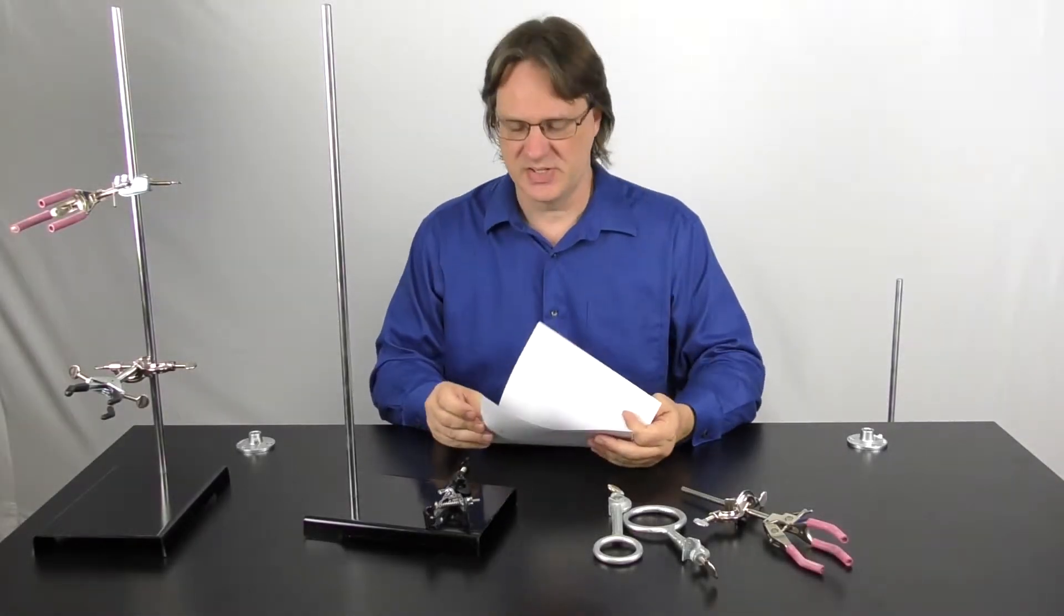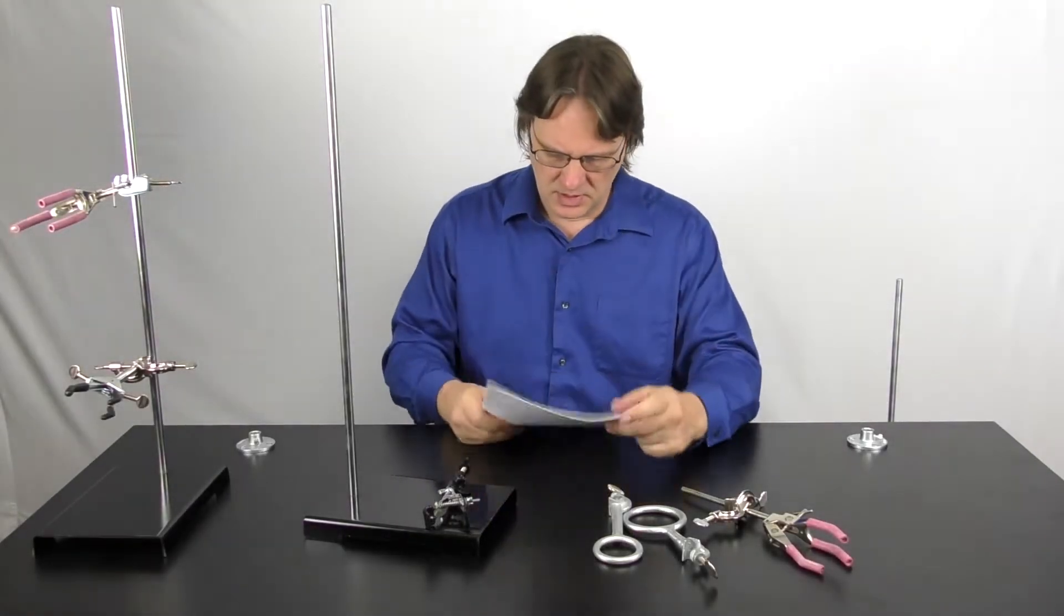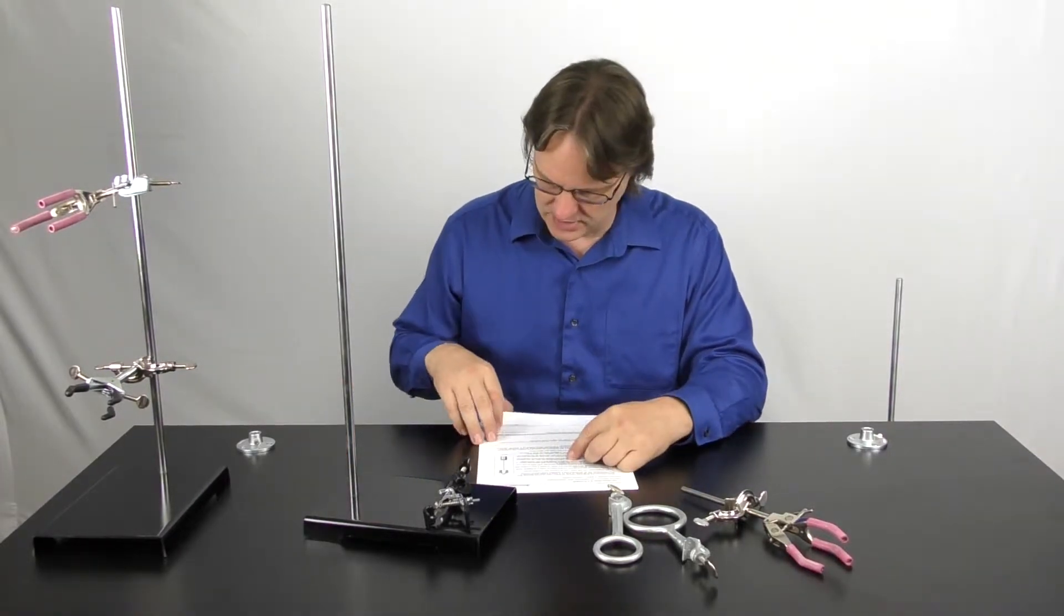All right, let me get all this stuff together for the lab. All right, so I got two support stands to hold that and that.